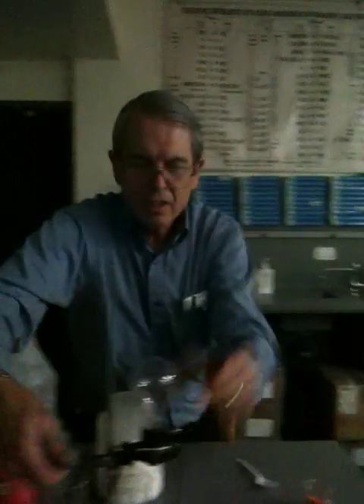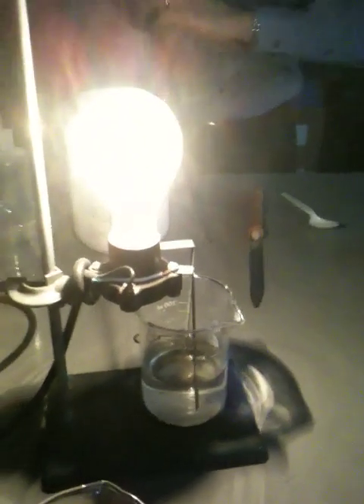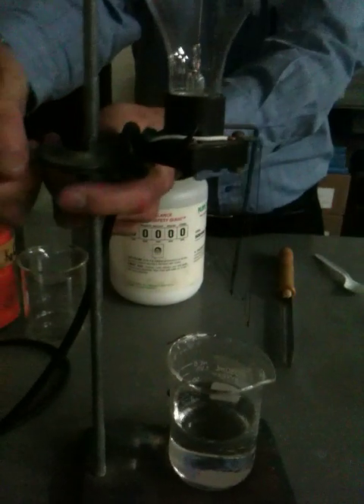Now — salt or sugar? Can't really tell by looking at it, can you? Could you tell by any other way? Sure you could — you could taste it. Let's test these and see which is which. Sugar won't conduct. Let's see what this guy does. Sugar. Salt. Oh, fooled you, huh? So we know that that one is the salt. We need another beaker of water — we'll test it and make sure it has no residue of ions that's going to make for conductivity. Let's get this out of the way and test this one. Your prediction is that this is the sugar?